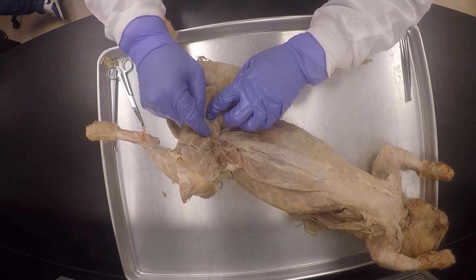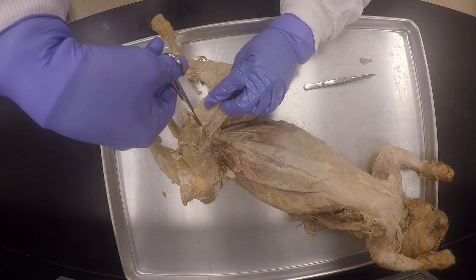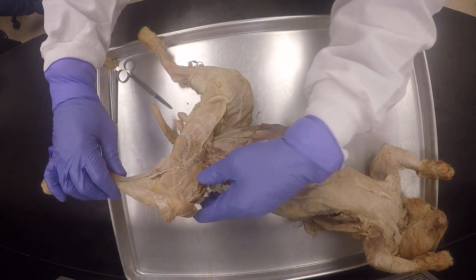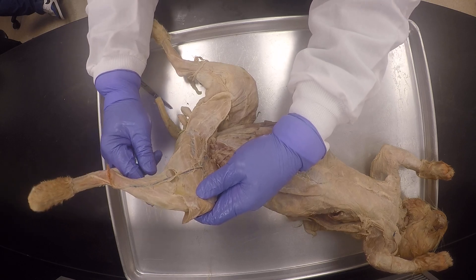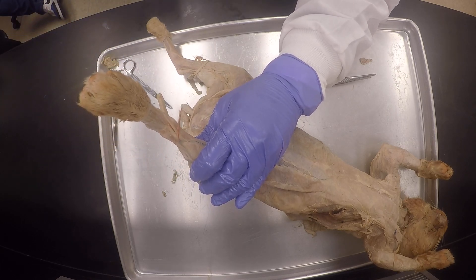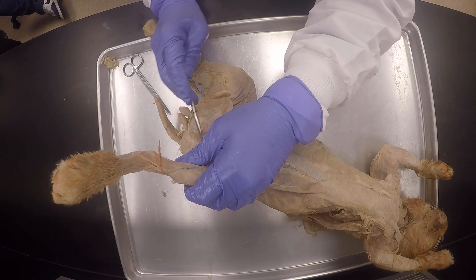You see how it's very easy to damage these muscles? Sometimes nerves can be very tough as well, so sometimes we have to just cut it. Do you see it's already separated like that? So this flat one here is semi-membranosus, and unfortunately my semi-tendinosus got cut here — it broke. Something tore it.